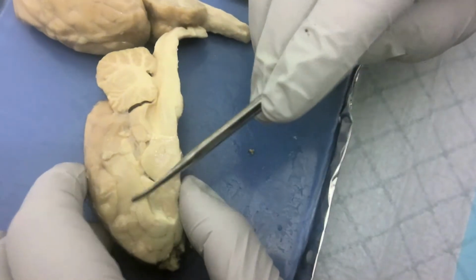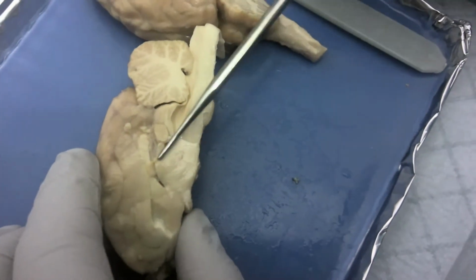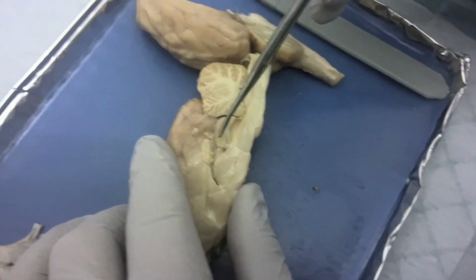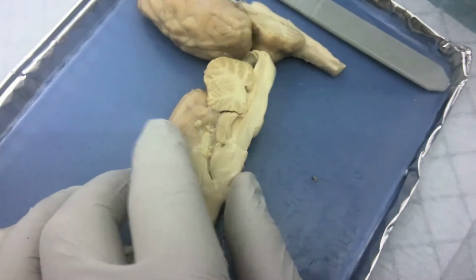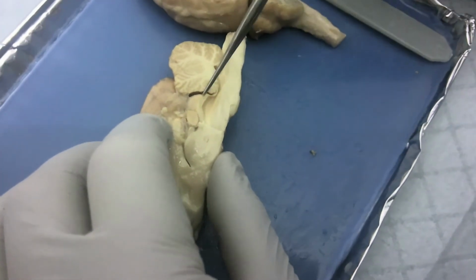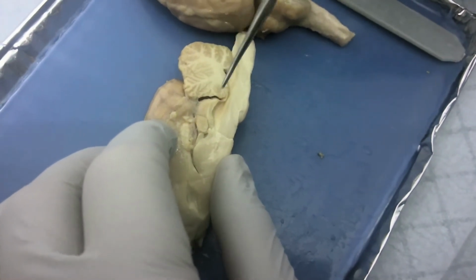Inside the brain here, we have the corpus callosum. Next we have the thalamus, which is about here, and the hypothalamus below that. The lateral ventricle, this is this gap here, and then the septum pellucidum and the choroid plexus. The third ventricle is going to be over here. The cerebral aqueduct is going to be here along the cerebellum, or underneath I should say, and then the fourth ventricle is going to be right here.